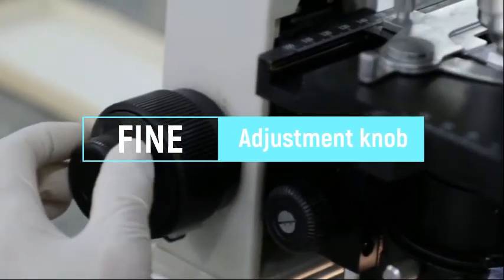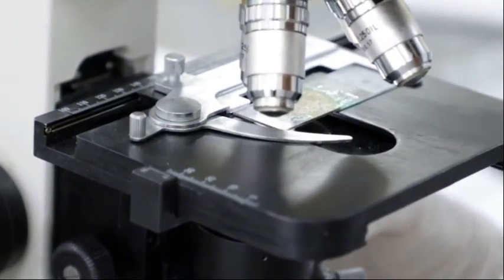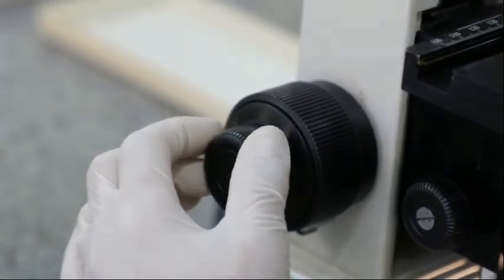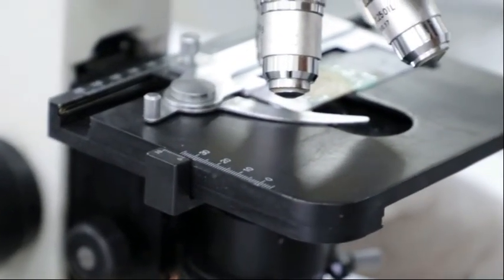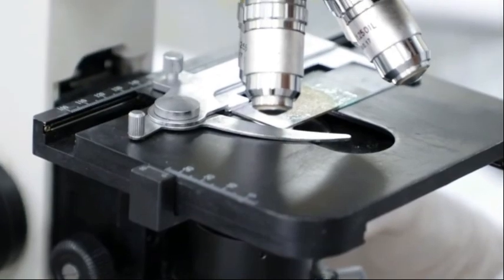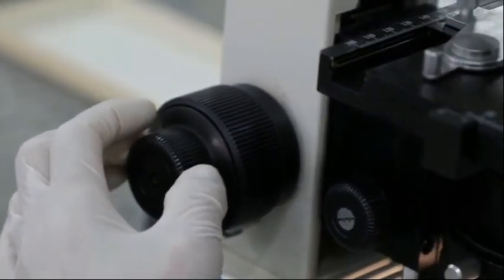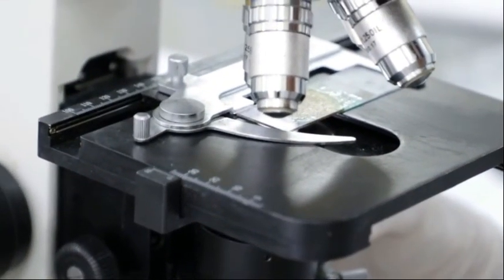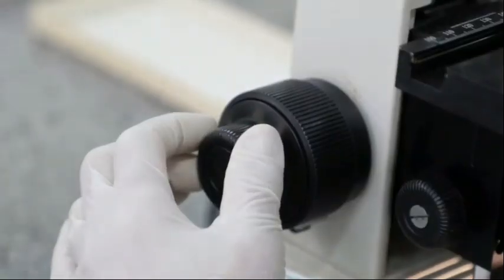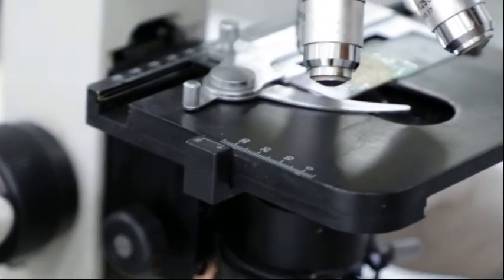The fine adjustment knob is used to ensure a cleaner view by sharpening the focused object. Once you have brought the stage close to the objective lens, the fine adjustment knob increases the resolution of the objective lens to give you a better, clearer view.